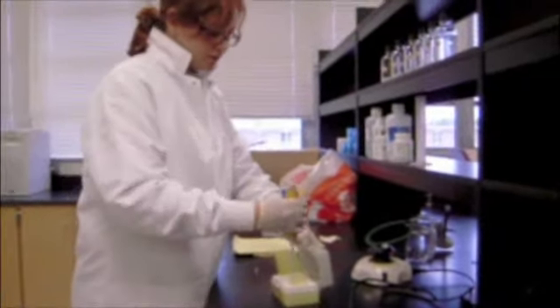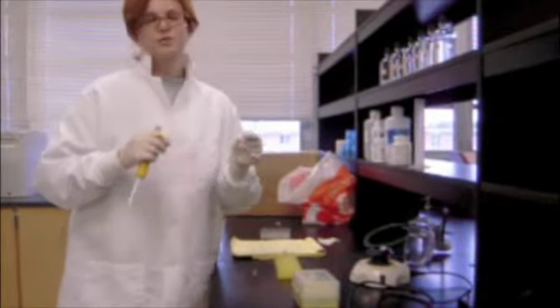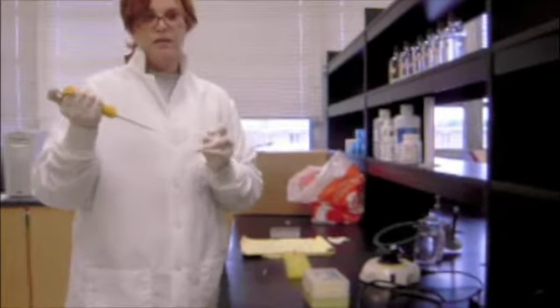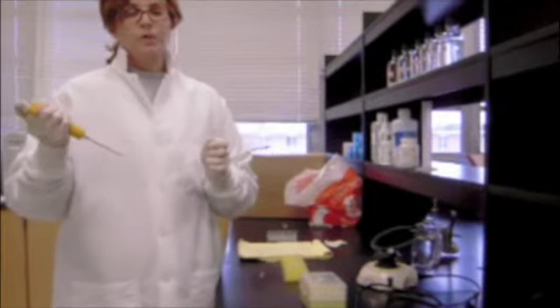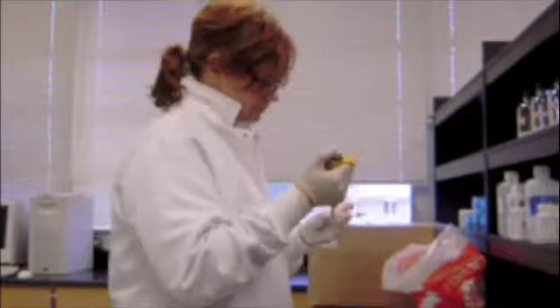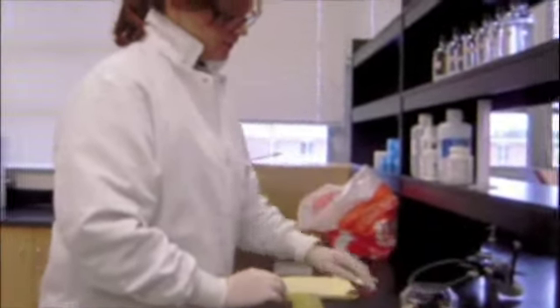Now, next thing I want to do is add some higher concentrated alcohol to precipitate the DNA, RNA, and protein from the solution. Precipitating it means that I'm bringing all of those molecules out of the solution. And it makes it cloudy. So now, I'm going to spin that again. And here comes the most miraculous part.